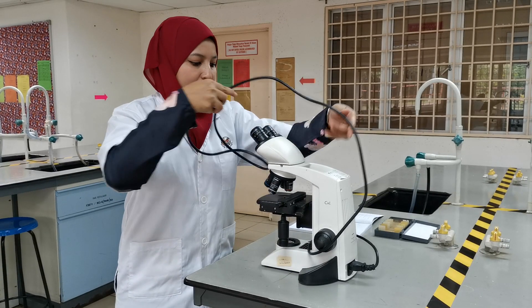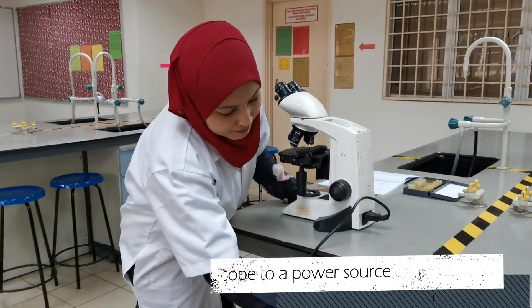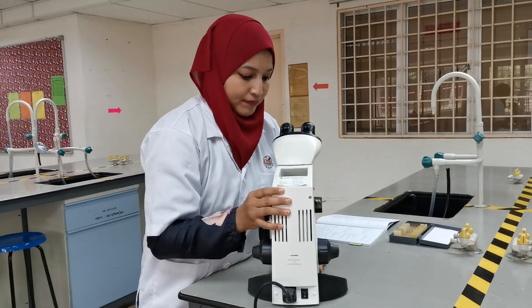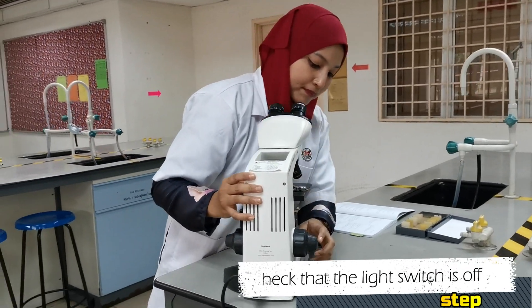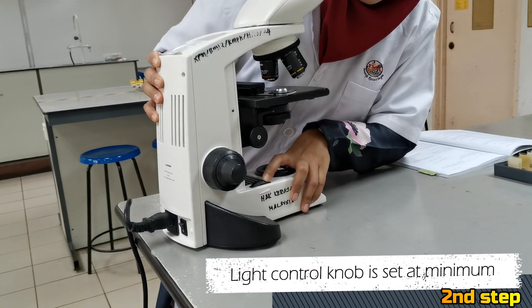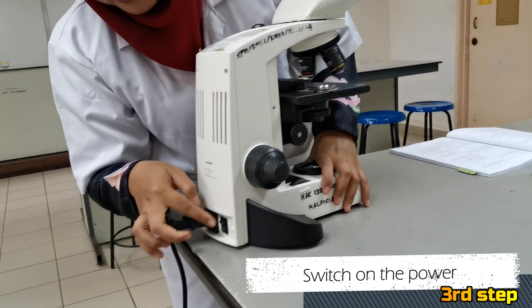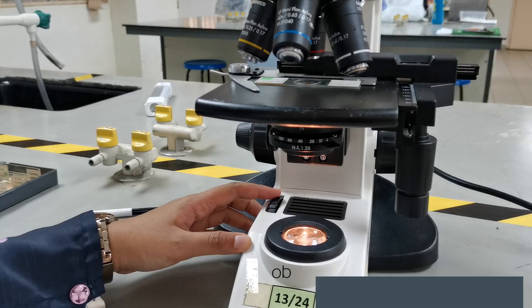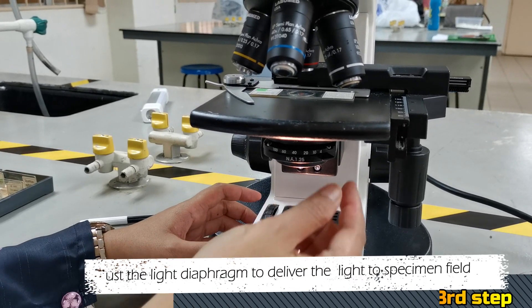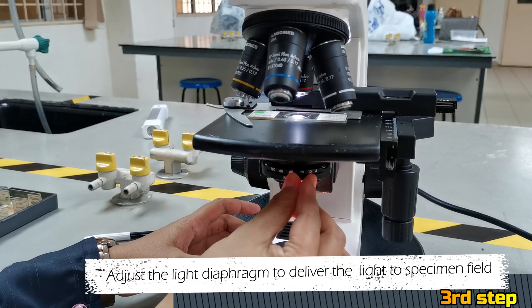To set up a light compound microscope, first you need to plug the microscope to a power source. Before switching on the plug, check that the light switch is off, or the light control knob is set at minimum. Next, switch on the power and turn on the light control knob or adjust the light diaphragm to deliver light to the specimen field.